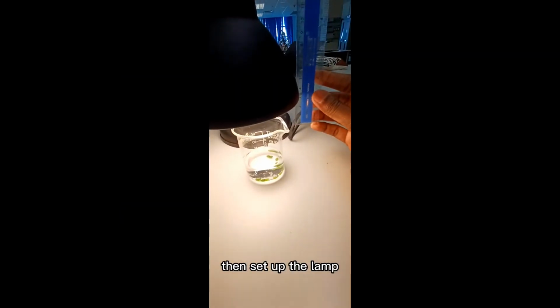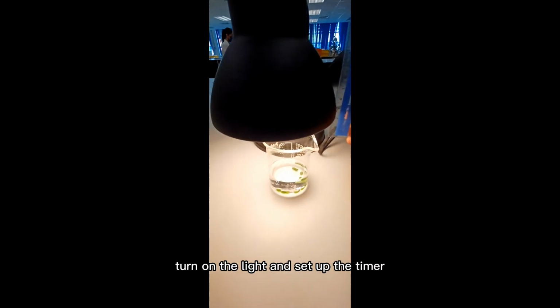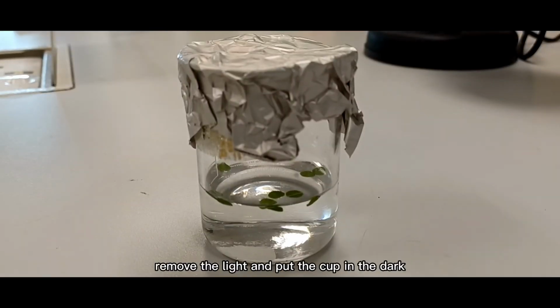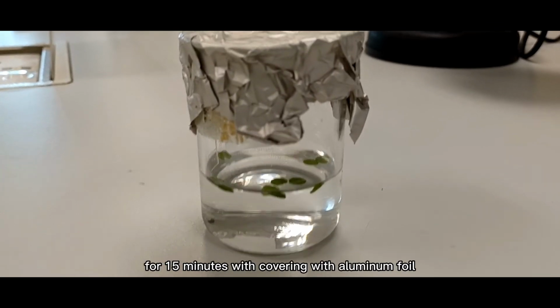Then set up the lamp about 3 cm above the beaker. Turn on the light and set up the timer. Record the observation. Once finished, remove the light and put the cup in the dark for 15 minutes, covering it with aluminium foil.